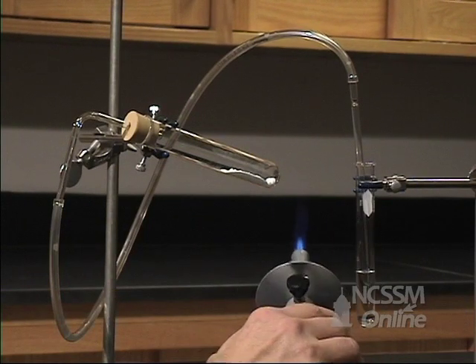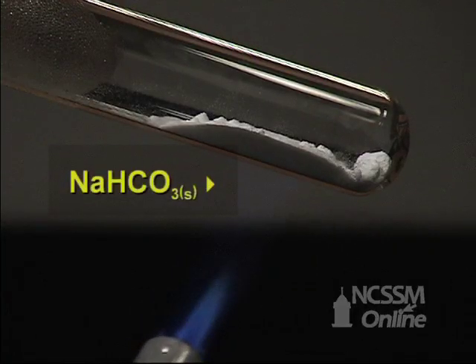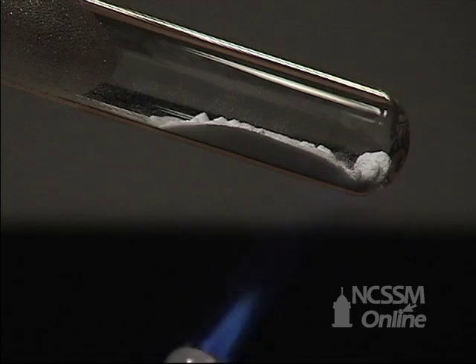We're going to heat some sodium hydrogen carbonate, and as the sodium hydrogen carbonate decomposes, the carbon dioxide will be bubbled through some lime water.